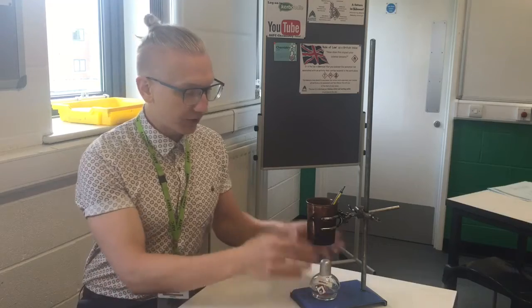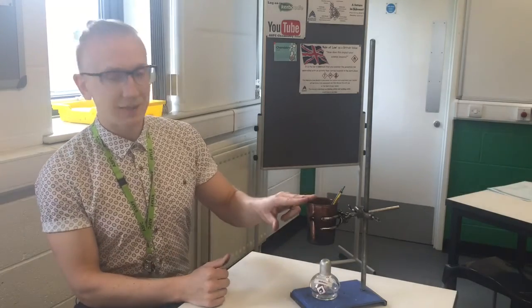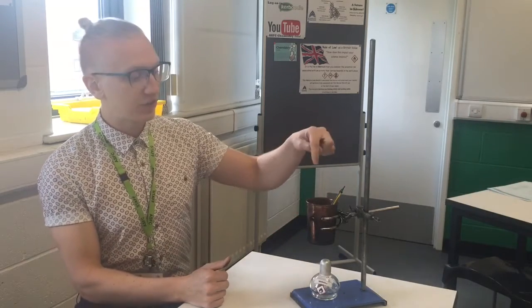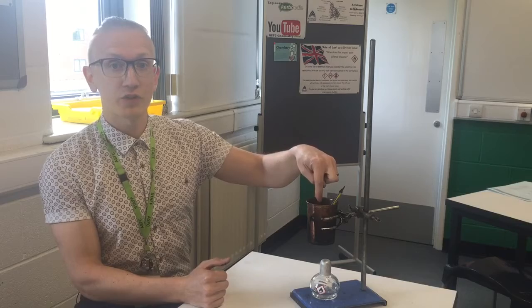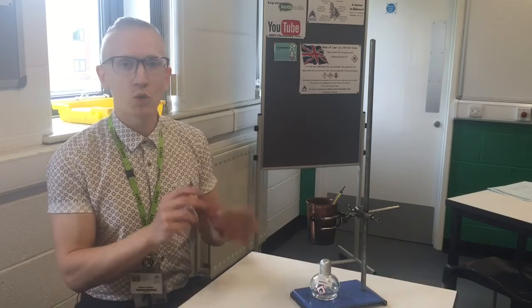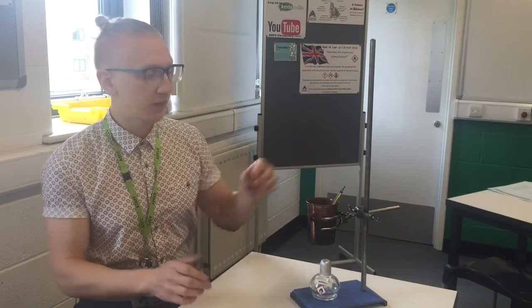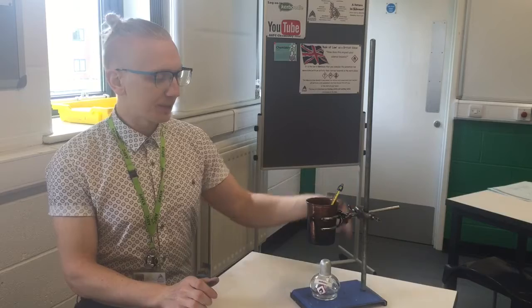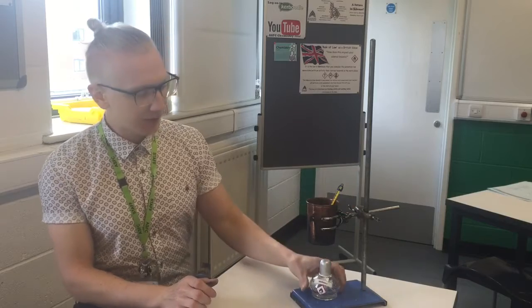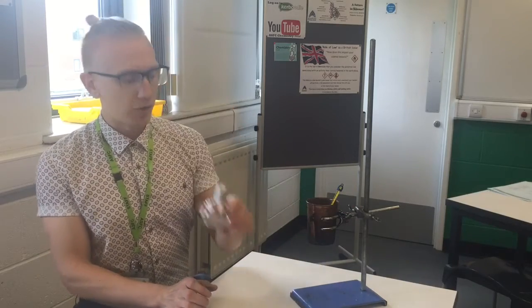First, let's look at what the setup actually looks like. We've got our copper calorimeter just here, which we fill with a known mass of water. We assume one gram equals one centimeter cubed for the water. We have a thermometer and a clamp stand all set up, and our spirit burner at the bottom.